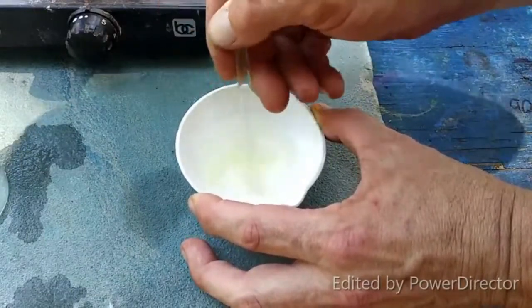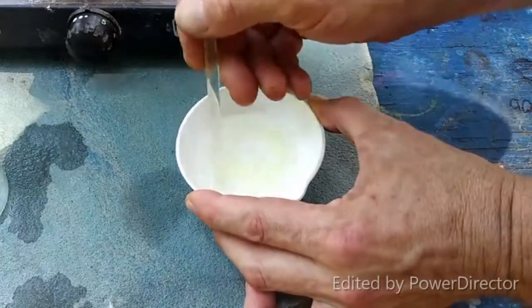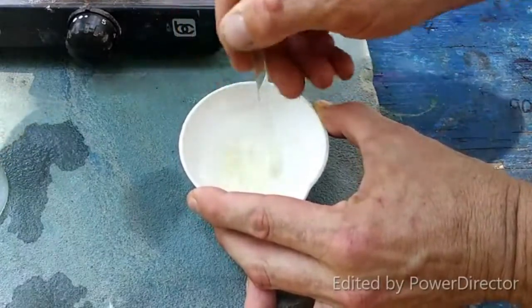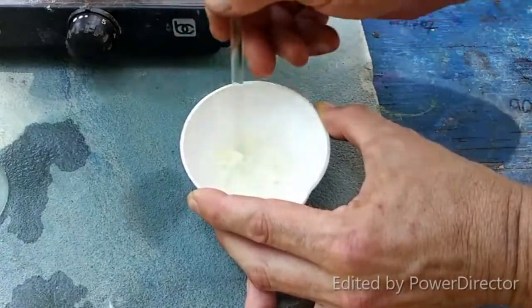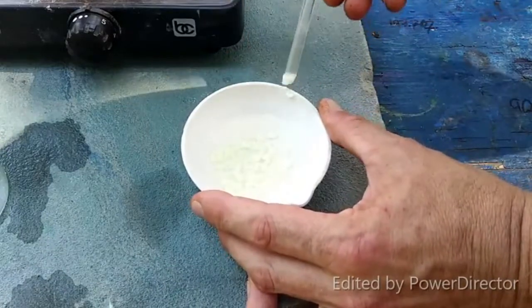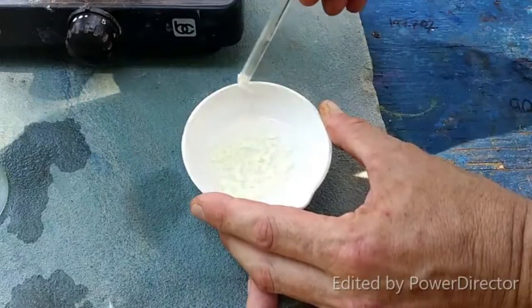Oh, very nice. I was wondering about that suction filtration step — I was questioning whether the author knew what they were writing. But apparently it turns into nice chunks, and it's always nice when you get a chunky product — at least when you're expecting or hoping for a chunky product.